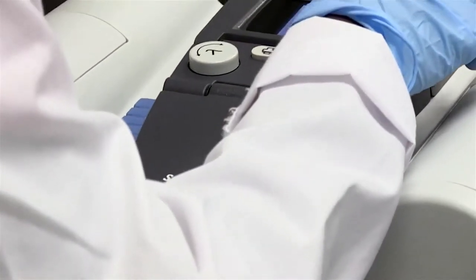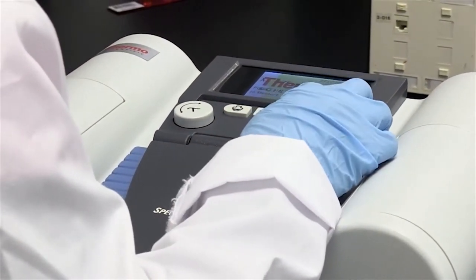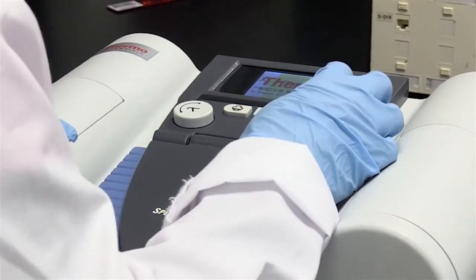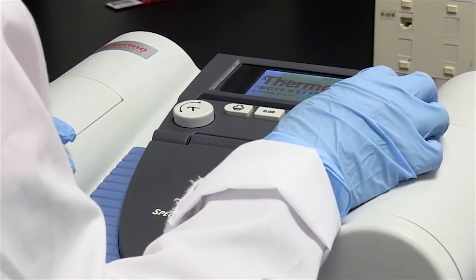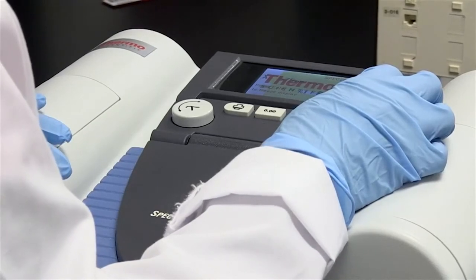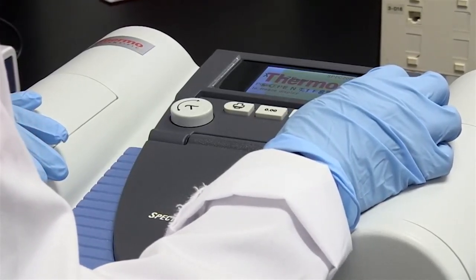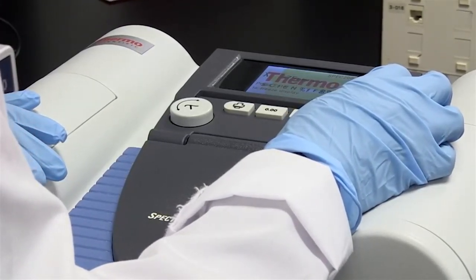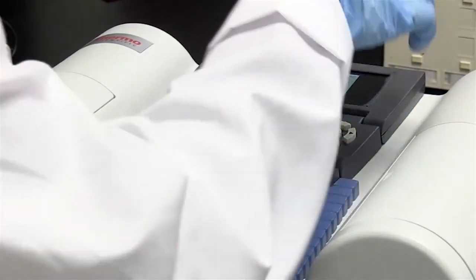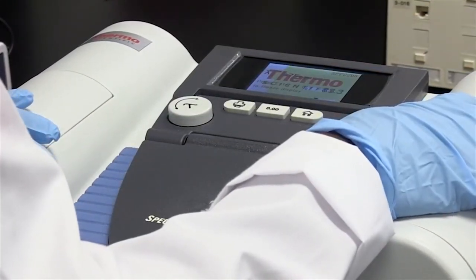I can then determine the absorbance. Right now it's actually telling me the percentage transmittance — it's 83.3%.